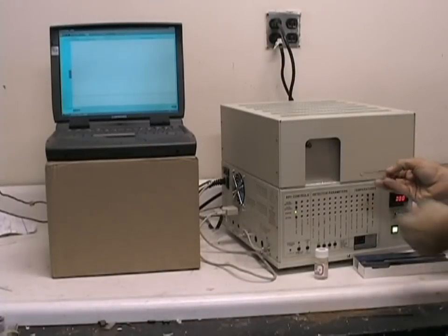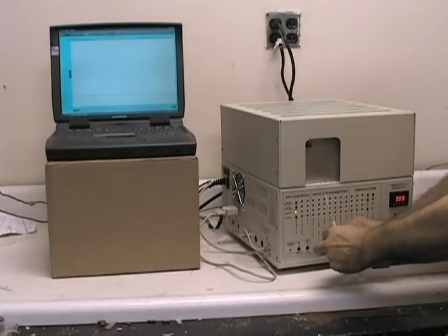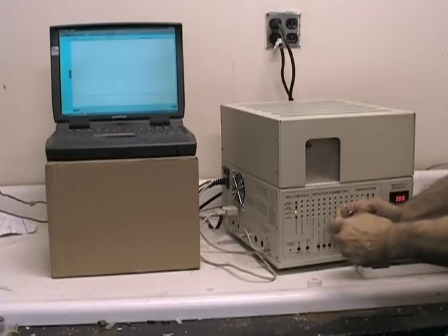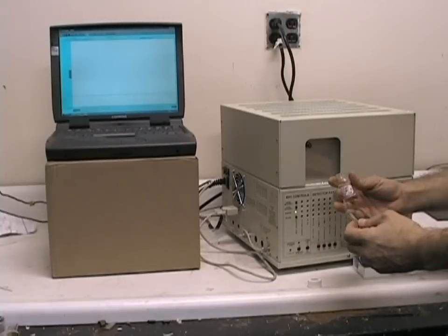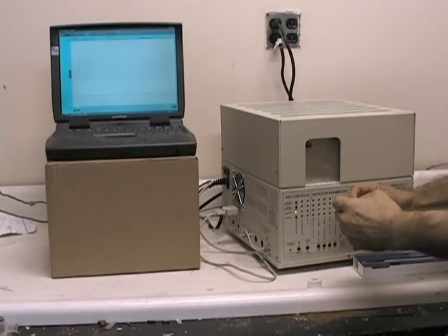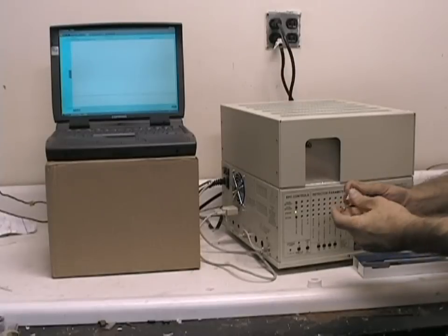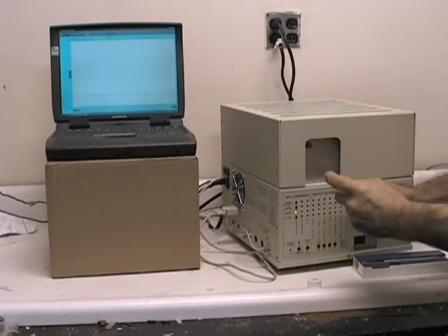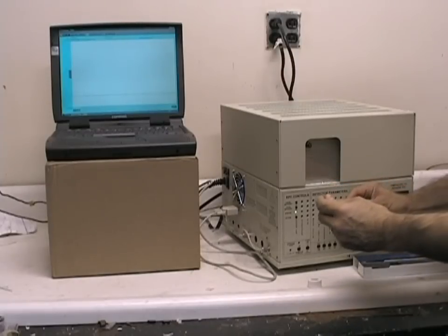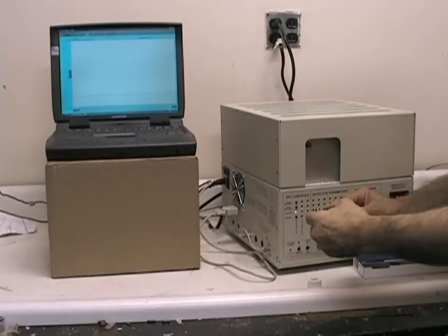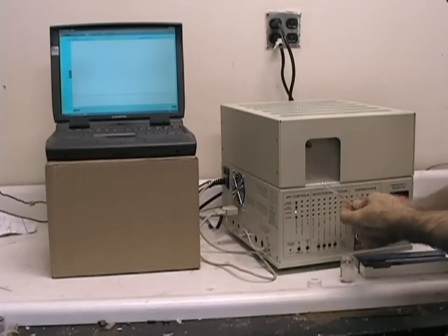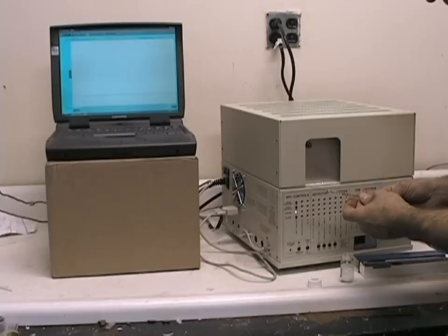Using the 10 microliter syringe supplied with the Buck Air GC, and whatever test mix you create, be it alcohols or low molecular weight solvents, it is recommended not to inject more than one microliter of any material to avoid overloading the column or the detector.